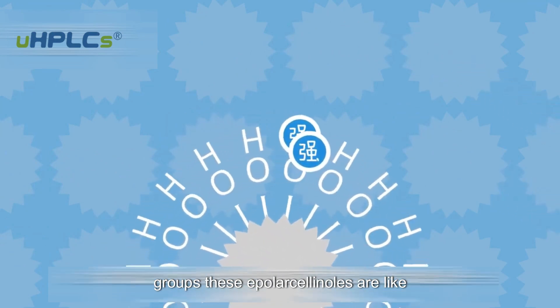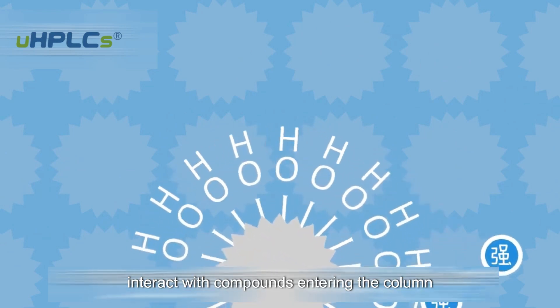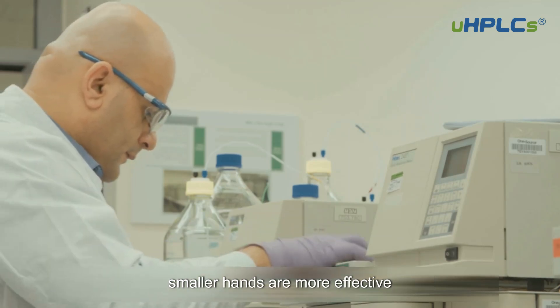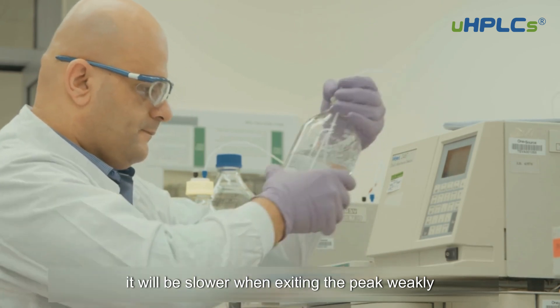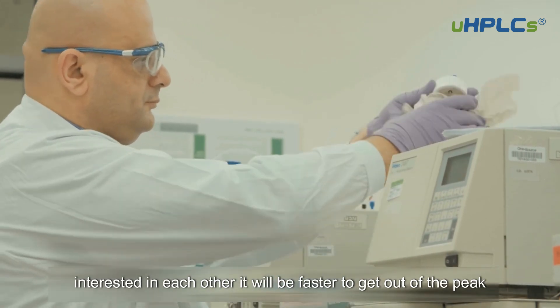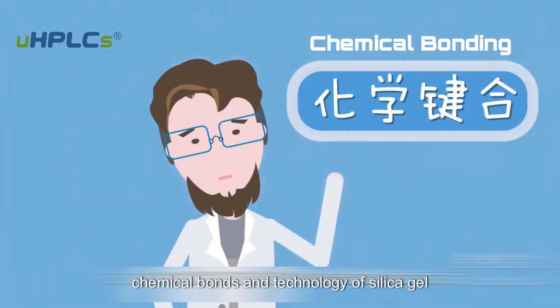These polar silanols are like little hands on both sides of the track, interacting with compounds entering the column. According to the principle of similarity and compatibility, more polar compounds interact more strongly with the silanols and will elute more slowly. Weakly polar compounds have little interaction with the silanols and will elute faster.